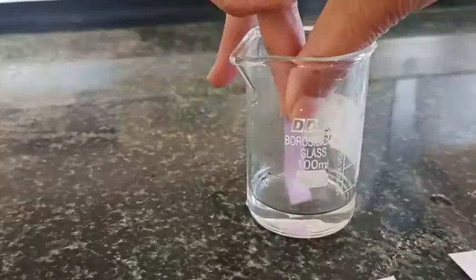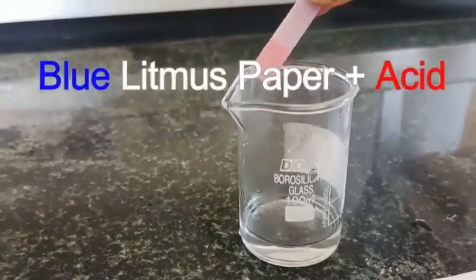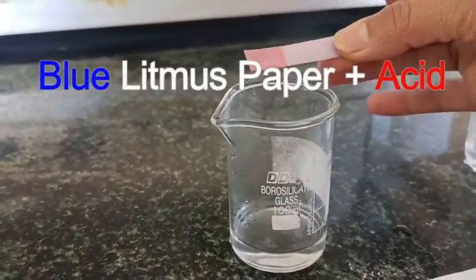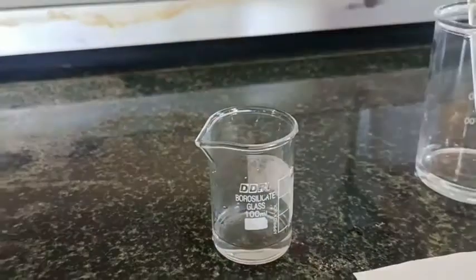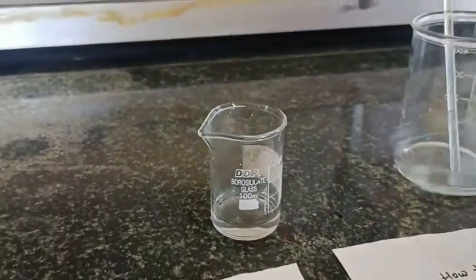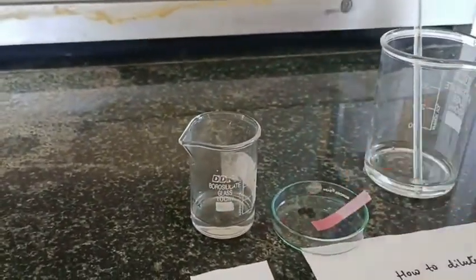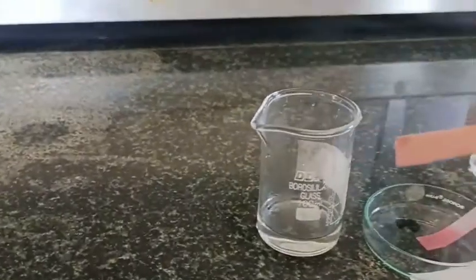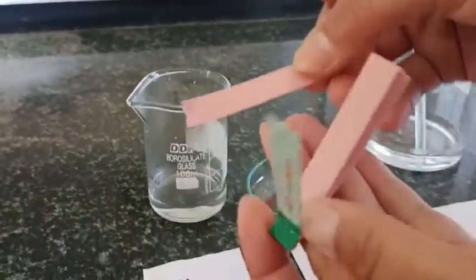Here I am dipping this blue litmus into the acid — this is a strong acid, HCl. You can see the blue litmus turns red. And here is the red litmus.